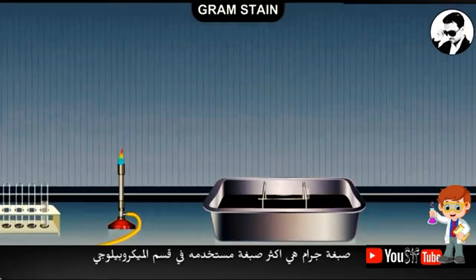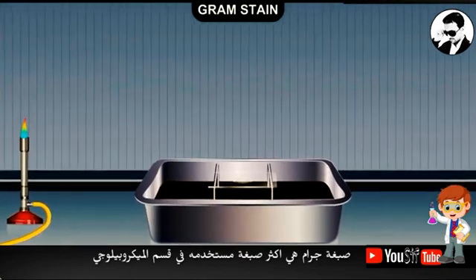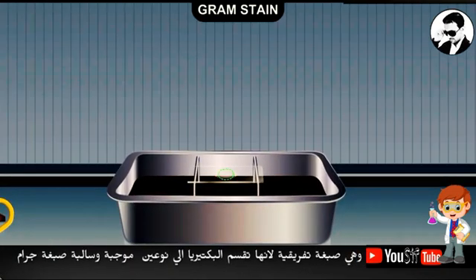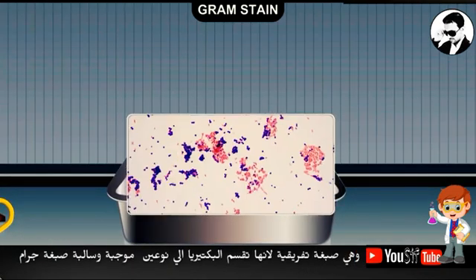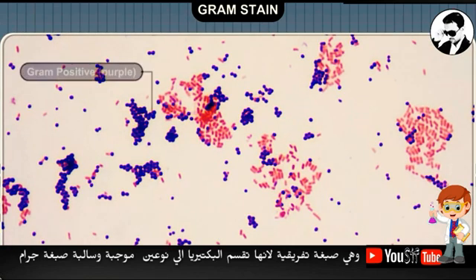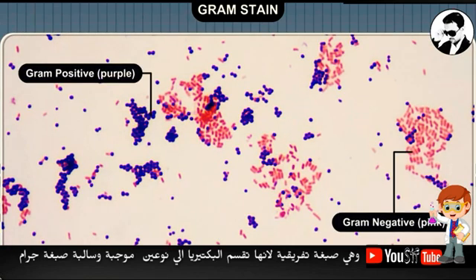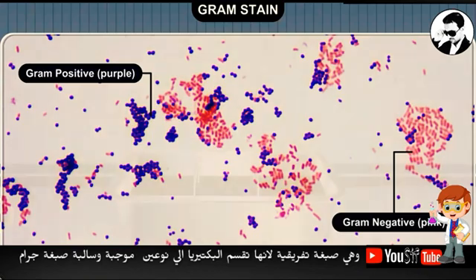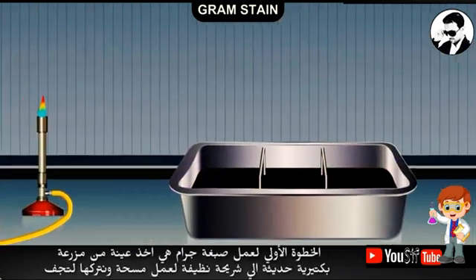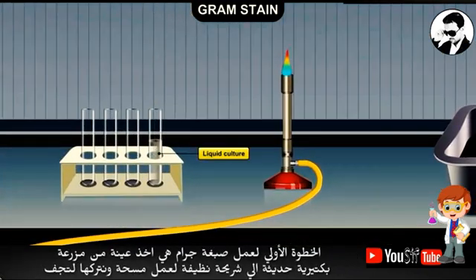The Gram stain is the most widely employed staining method in microbiology. It is a differential stain because it divides bacteria into two classes: gram-positive and gram-negative. In the first step of the Gram stain procedure, cells from a fresh culture are transferred to a clean slide and allowed to dry.